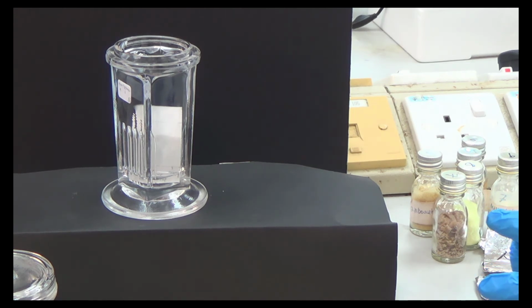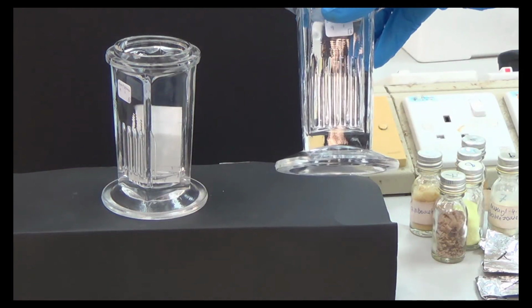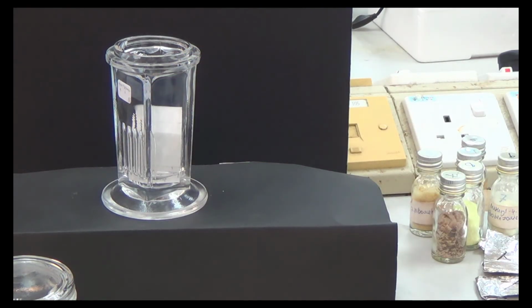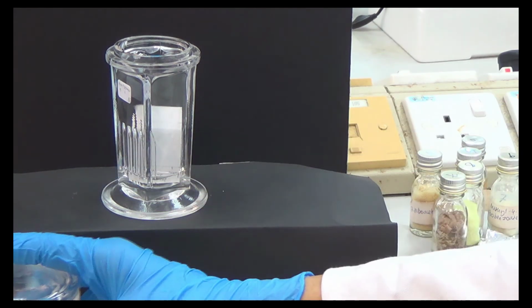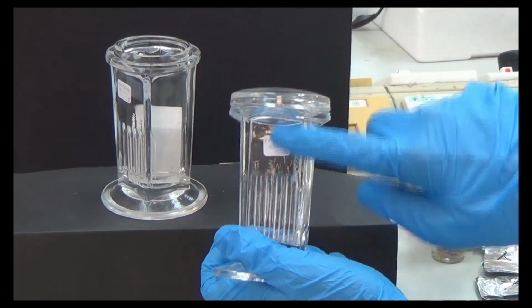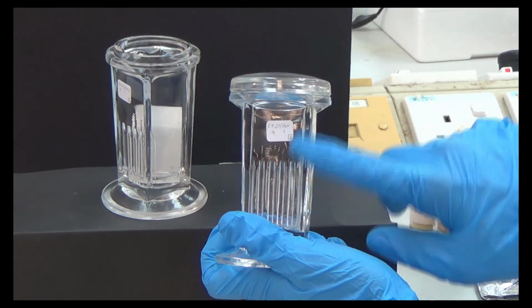Because what? Anyone? Question? This is a question: why do you use a different solvent? You can answer this, you get 2 points. Can I try? Yes. Maybe because the first solvent can be contaminated by the earlier compound. The earlier compound, the X one? Okay, you get one only. I mean, this we use for the X. All the previous ones that we used were for X.